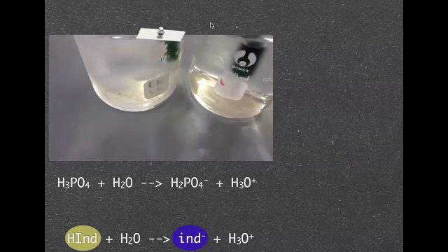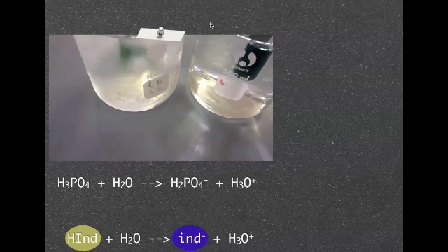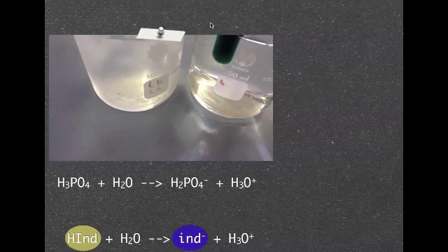Obviously you can see a sort of change in color, you can see the one on the left hand side there going a bit lighter green and the one on the right there turning a bit of a bluey color there as well.